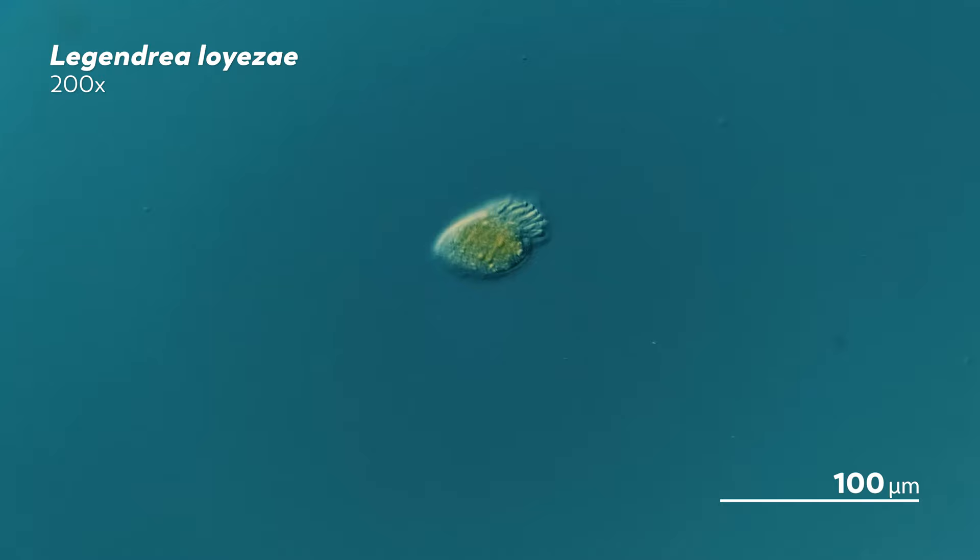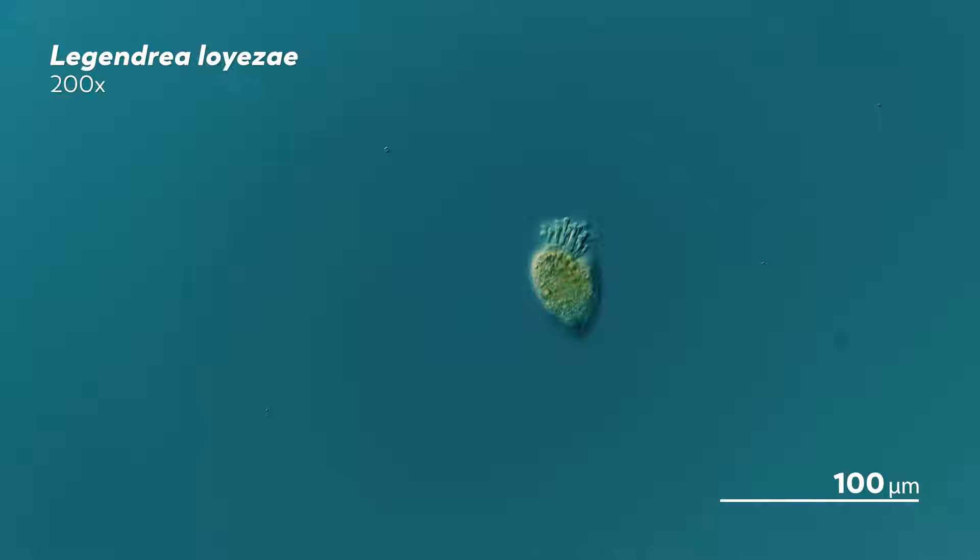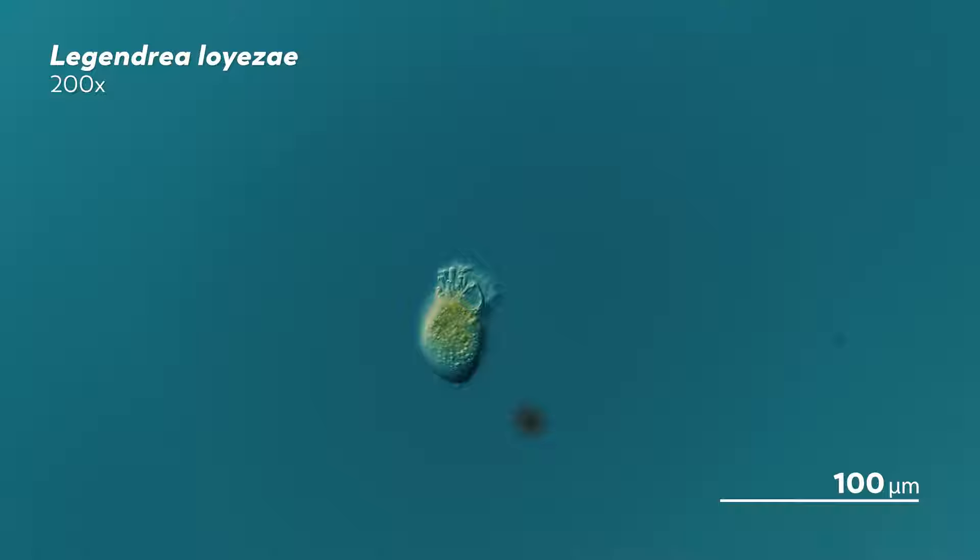To study organisms at the genetic level, we need their DNA. Which means that we need to be able to wade through all the bits and pieces lying within their tiny bodies to pick out something even tinier — something that we cannot just dig out with a shovel. So, how?